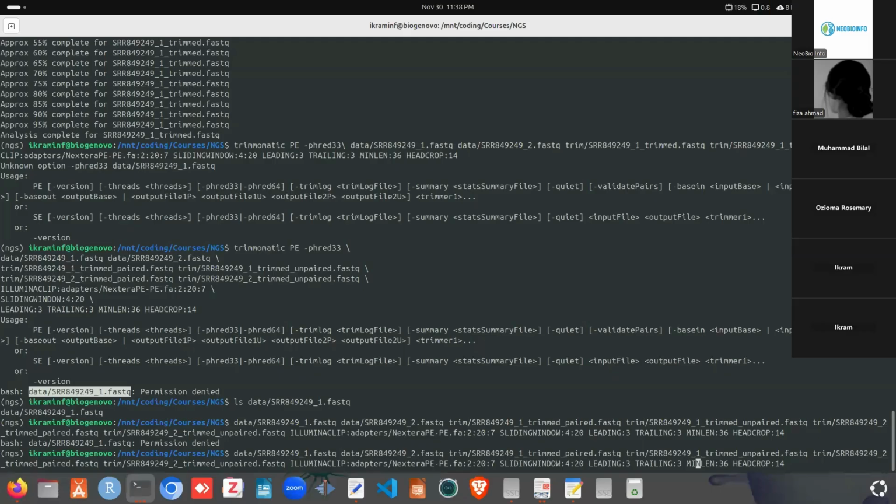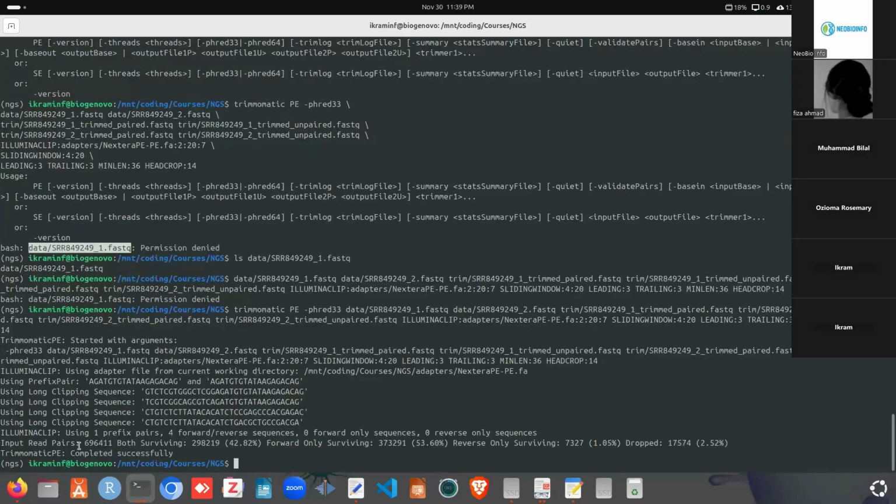Okay, so here is the problem actually. We can see in here after the input reads, we can check the both surviving. Both surviving means the read survived in R1 and in R2. So the percentage is 42.82%, and only forward survived, that is only the read from the R1 file survived, is actually 53.60%. Reverse only survived is 1.05%, and Trimmomatic dropped 2.52%. These are actually our main content. Both survive, that is written in the paired files, and we will perform our next analysis on these paired files.